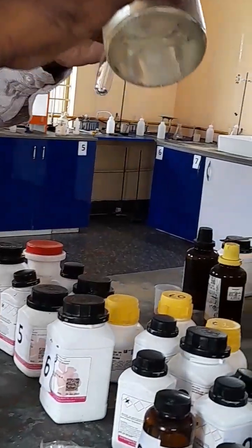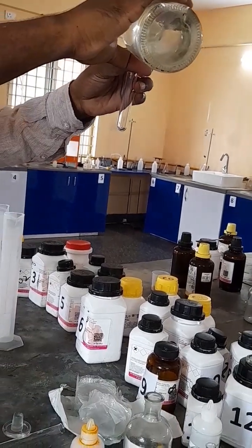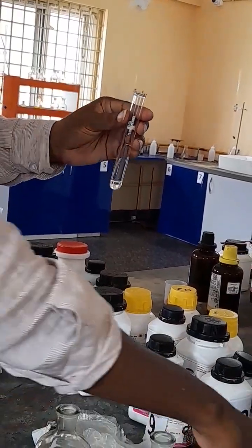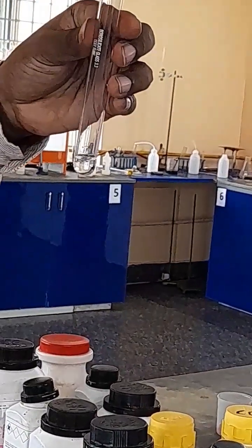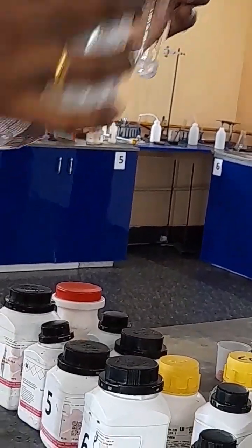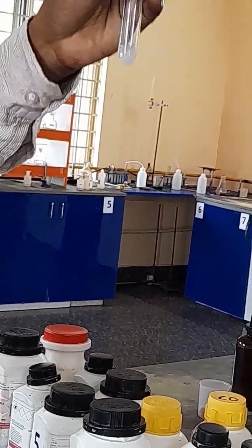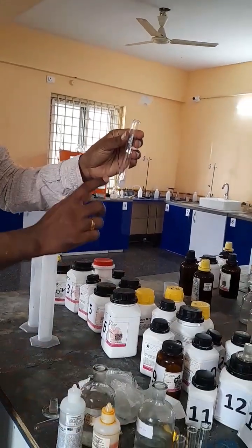Into this test tube I have added dilute HCl, that is an acid. Now again I am going to add phenolphthalein. You can see you cannot observe any color over here — it gives a colorless solution.